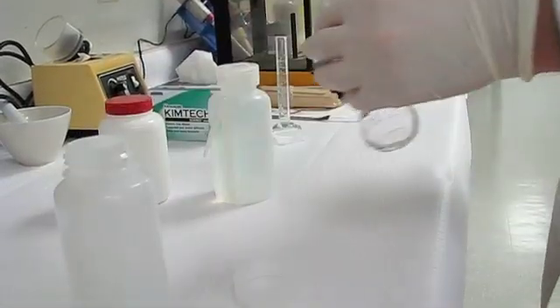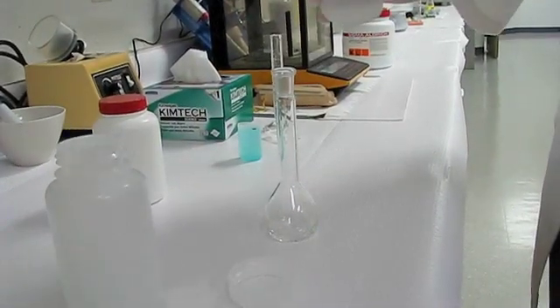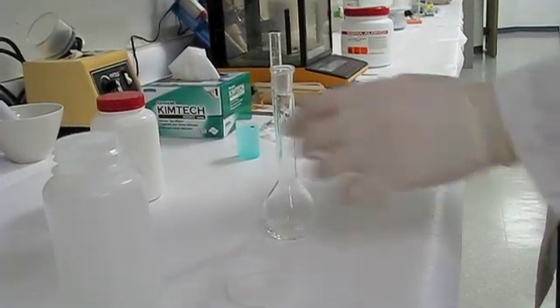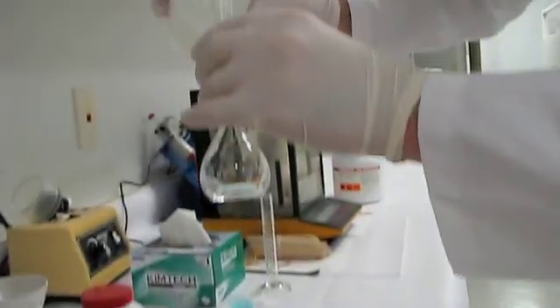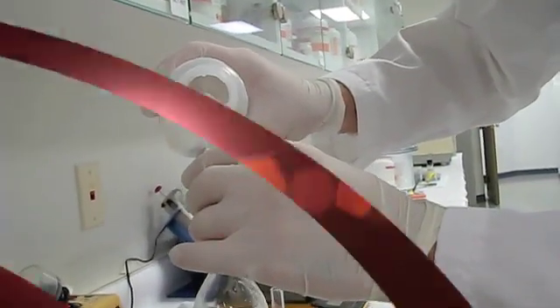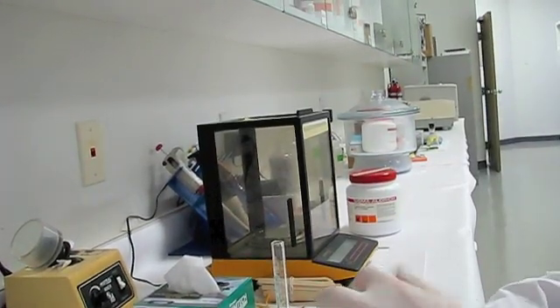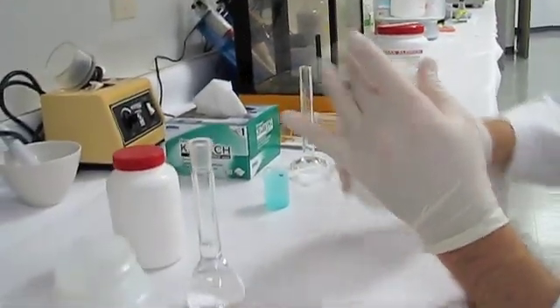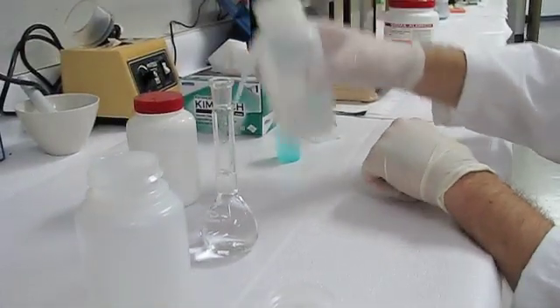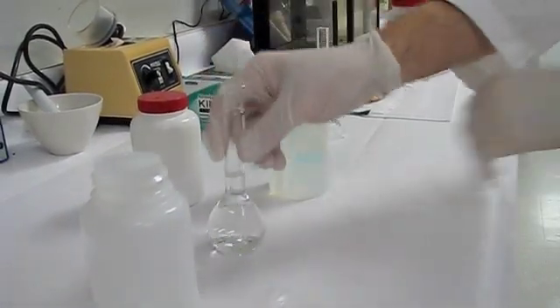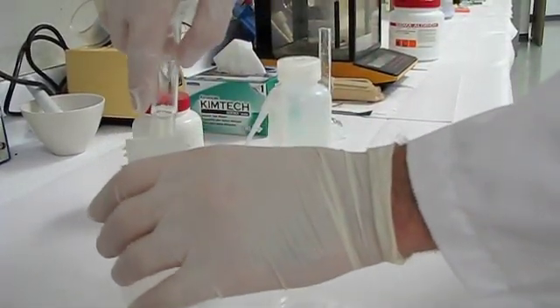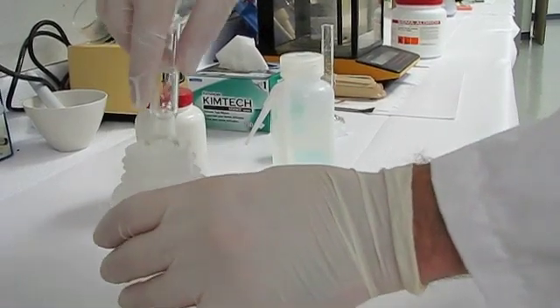So I'm going to fill this half full, make this go a little faster now, I'll just add the water this way. So again, I got half of my 200 milliliters here, so I'm going to dissolve this as much as I can.